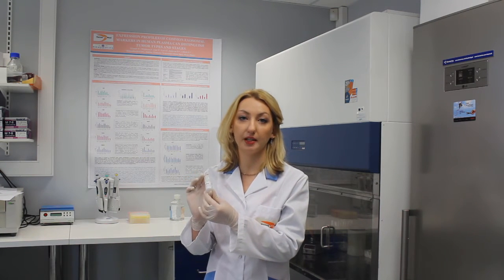Hello. Today I am going to tell you about Exoprep, a reagent for fast and easy isolation of exosomes from biological fluids or from cell culture supernatant. The method is based on chemical precipitation. Procedure is easy to perform and takes around one hour. Let's see how it works on example of human plasma.